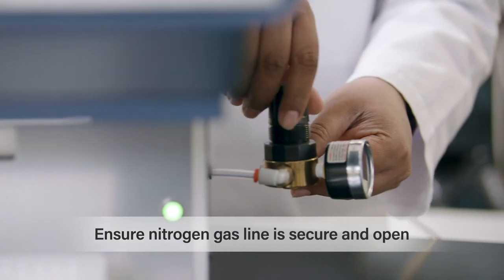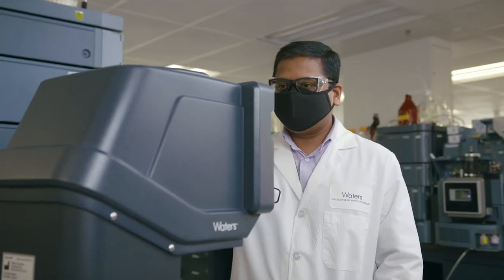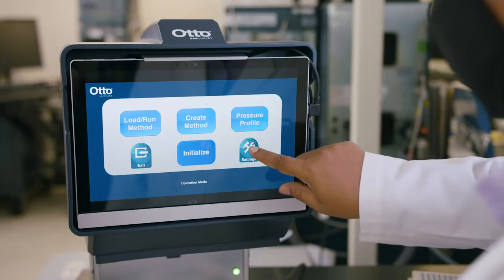To safely begin, ensure the nitrogen gas line is secure and open. Then simply open the Otto software application.